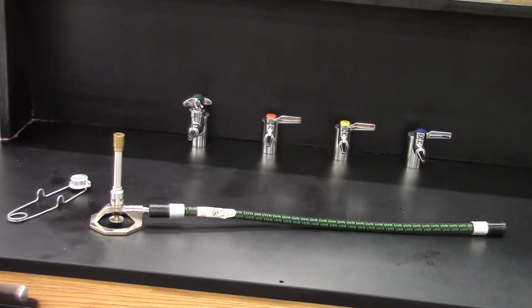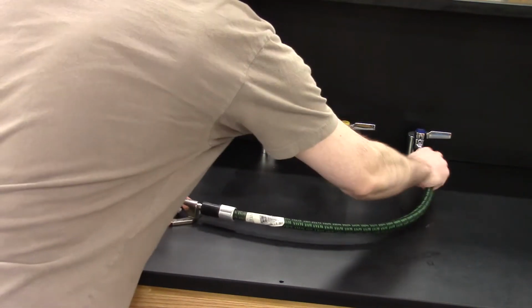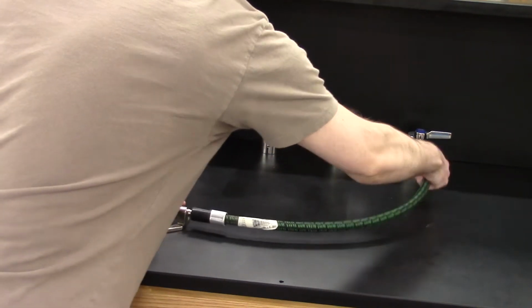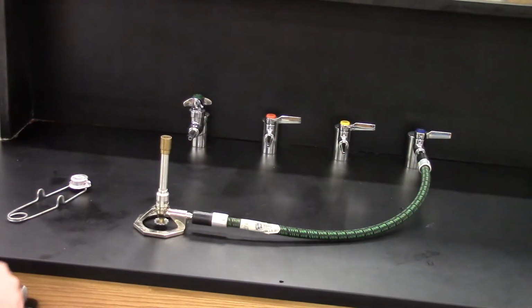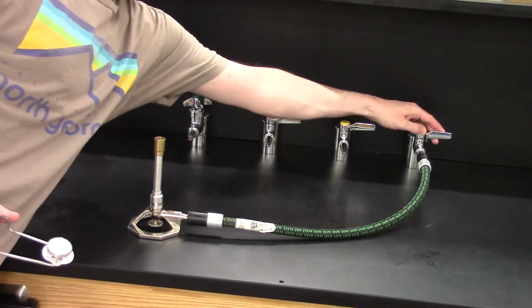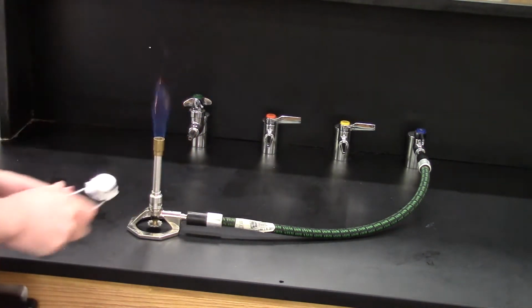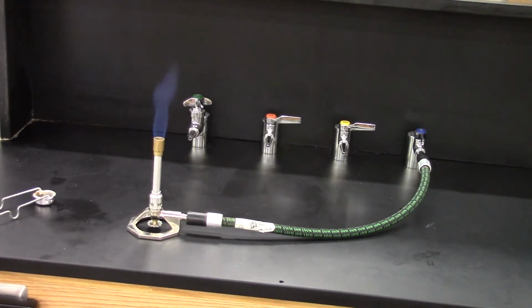In part A of this experiment, we're going to be looking at a piece of equipment known as a Bunsen burner. This is a laboratory device that is used to produce a flame from the combustion of natural gas with oxygen in the air. In this video clip, I'm connecting the inlet hose of the burner to the natural gas, opening the gas valve, and using a flint striker to start the combustion. I then adjust the airflow to get the ideal air-fuel mixture. You can see that there is a nice blue flame.